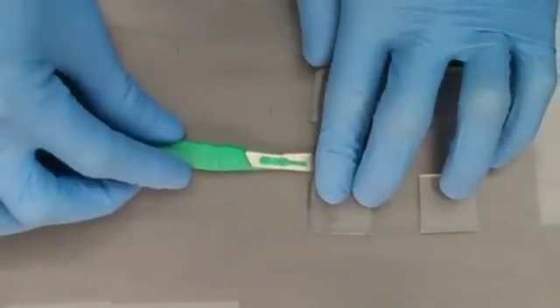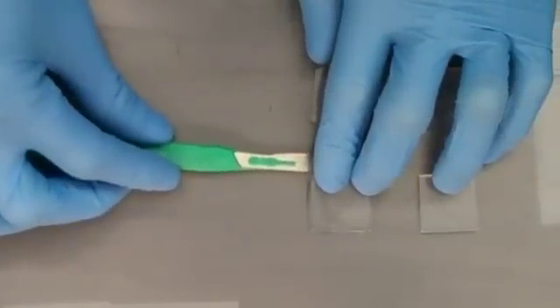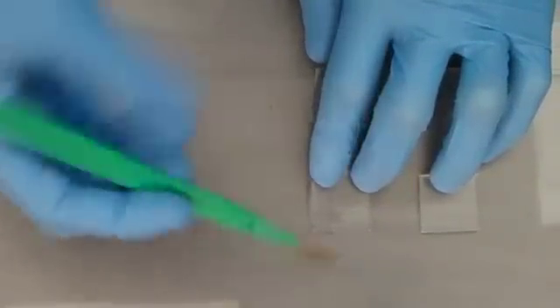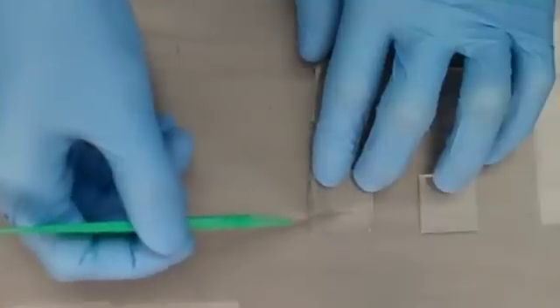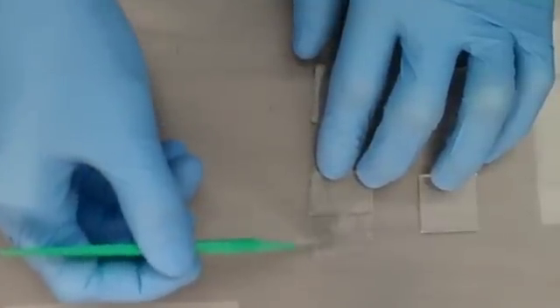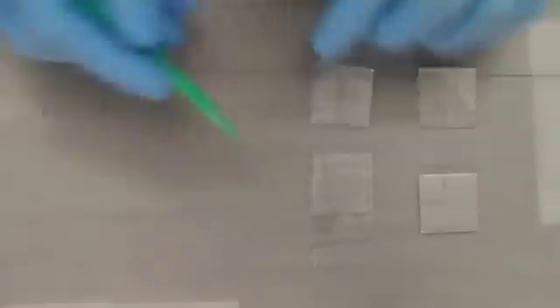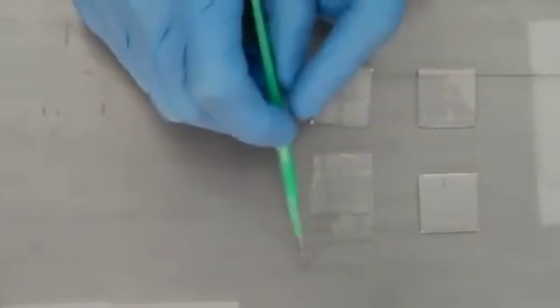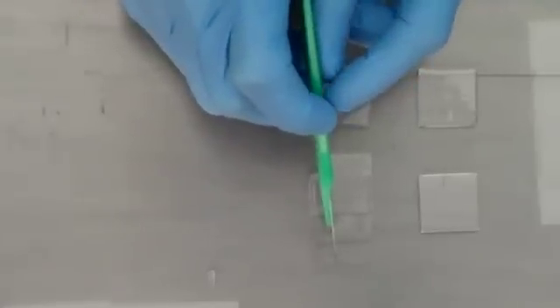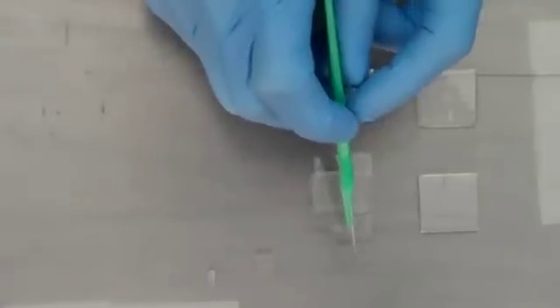You can partially expose the pad using the blunt end of the scalpel as a backstop and sliding the top cover glass over it. Cut along the agarose pad using the cover glass as a straight edge. Cut at intervals to make similar sized pads.